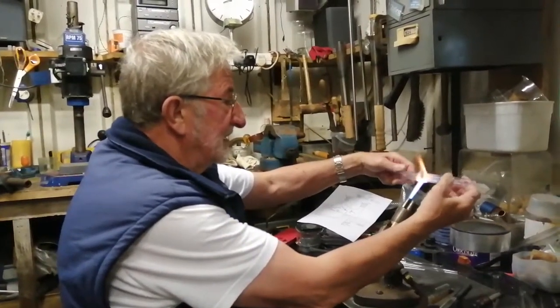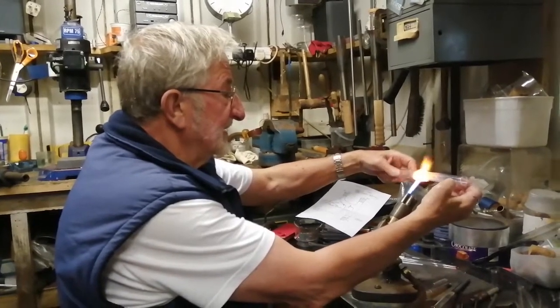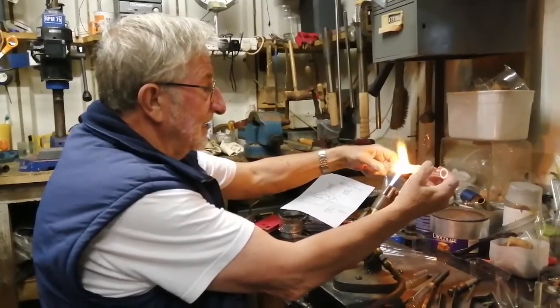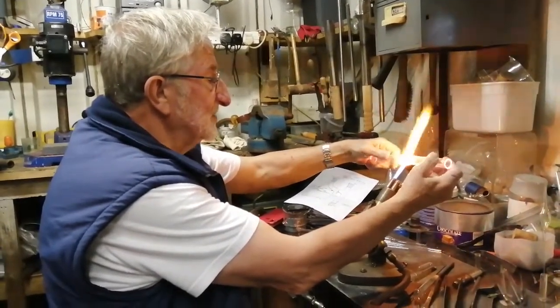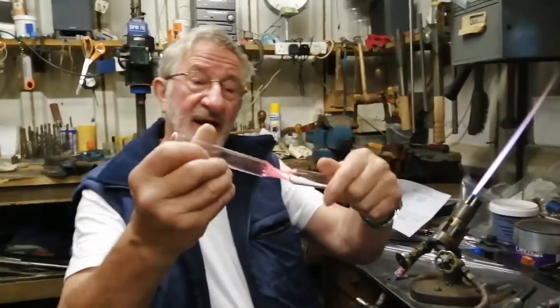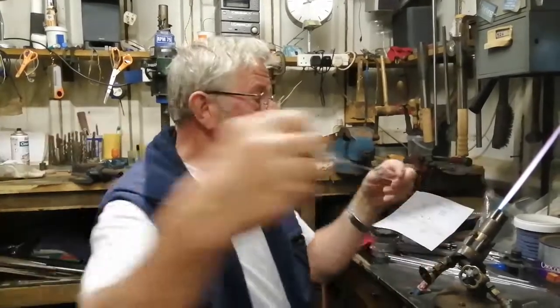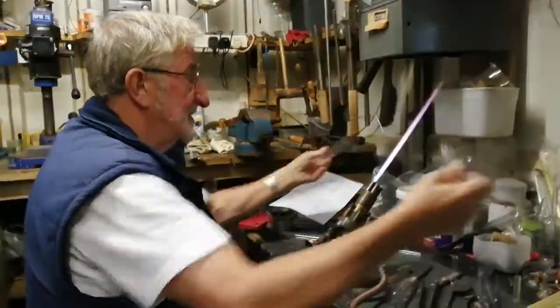So you can see that I've got my left and right hands supporting a piece of plain tubing. Nice blue flame. Notice that there's very little splash, so I can hold my fingers quite close, so the glass blowing is generally safe if you follow a few basic rules. And I just heat and turn, keep pulling and stretching, just turn at the end when it goes hard. And that's that. I can stop again.